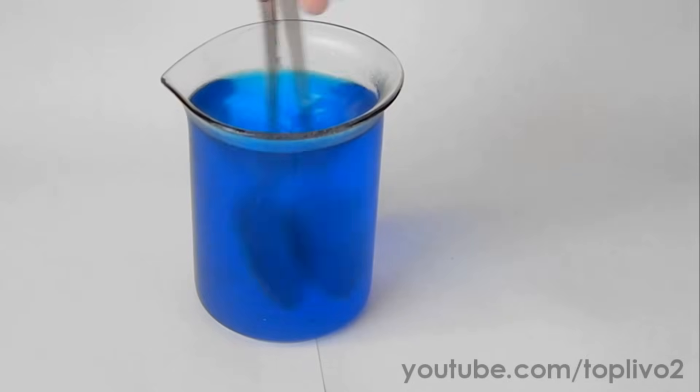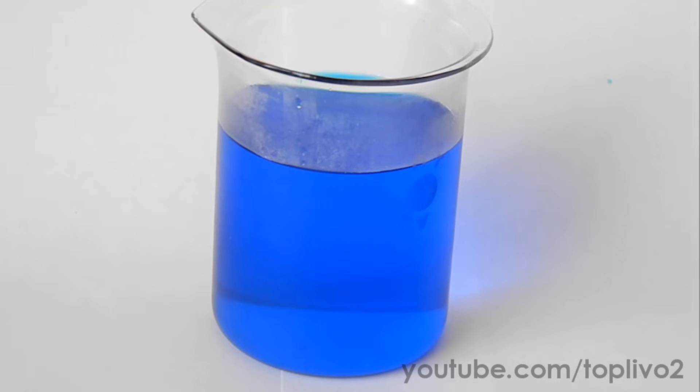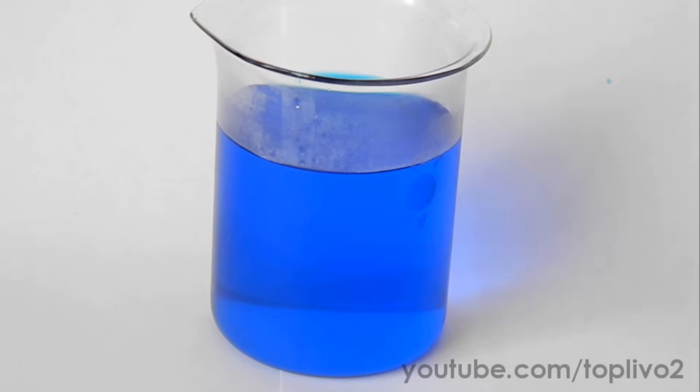After the salt is no longer dissolving and the solution becomes saturated, it must now be filtered to get rid of various impurities. After filtration, add to the bottom of the glass a little copper sulphate and leave the glass for a few days to let the crystals form.